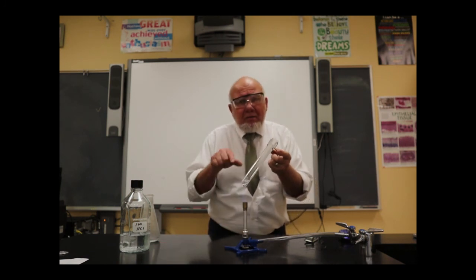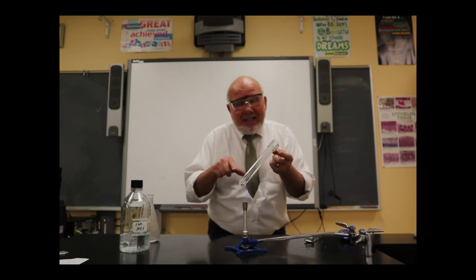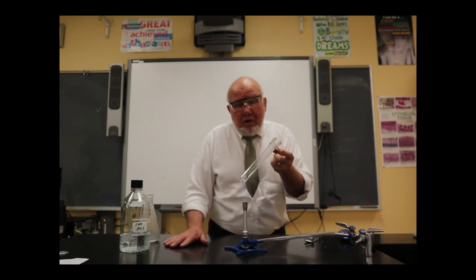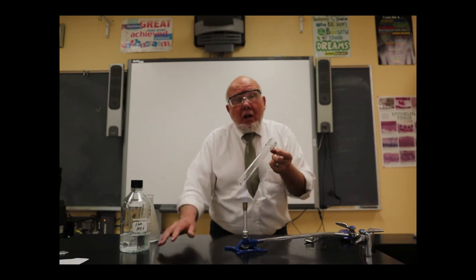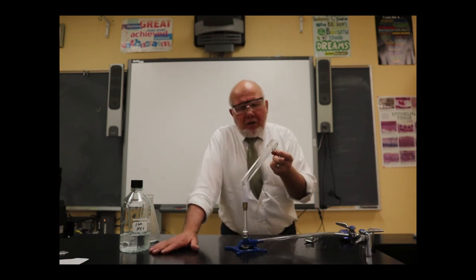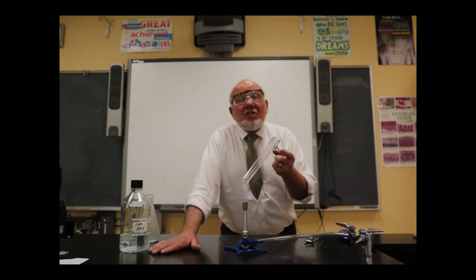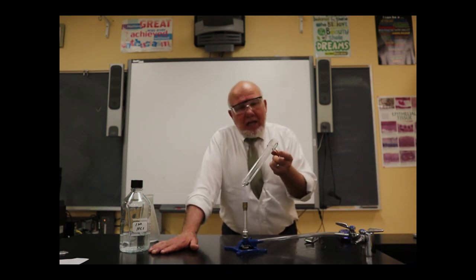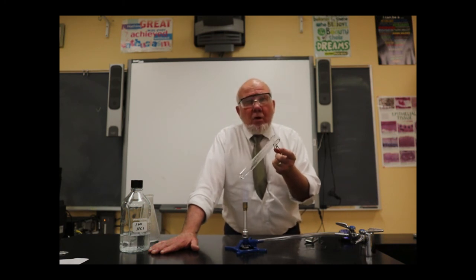Well, the magnesium chloride is dissolved in the water. We can't see it because it's dissolved, but once you get rid of the water, then you can see the white solid. Hopefully it's a white solid, I suspect. Most salts are. This is magnesium chloride. Regular salt is sodium chloride. When I say regular salt, it's the salt we're most familiar with, table salt.